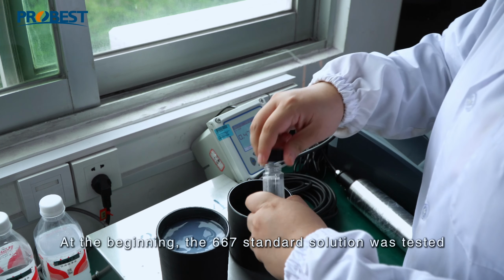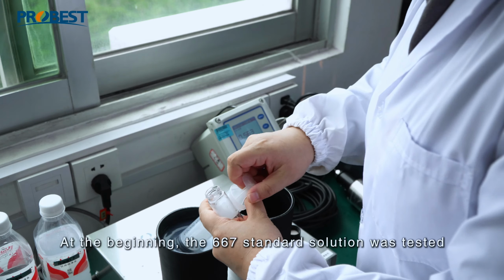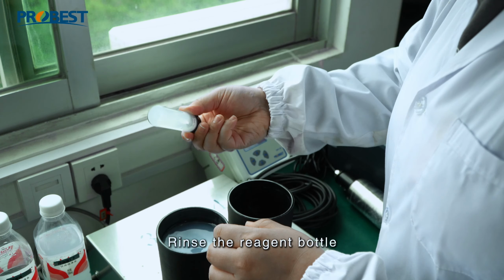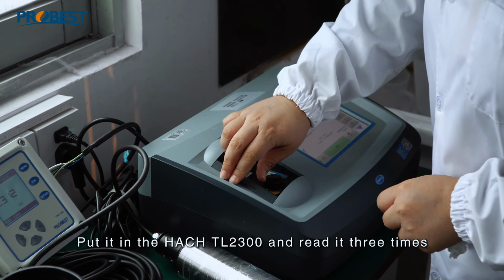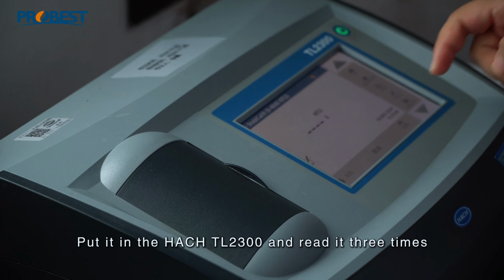At the beginning, the 667 standard solution was tested. Rinse the reagent bottle. Fill the solution again. Put it in the Hach TL2300 and read it 3 times.